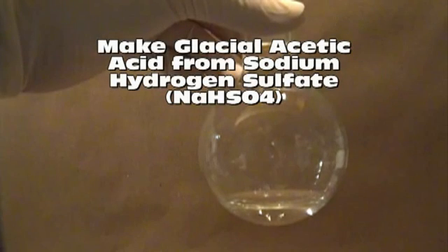Hello YouTube! In this video, we'll again be making glacial acetic acid, but this time we'll be using sodium hydrogen sulfate instead of the much more dangerous 98% sulfuric acid.